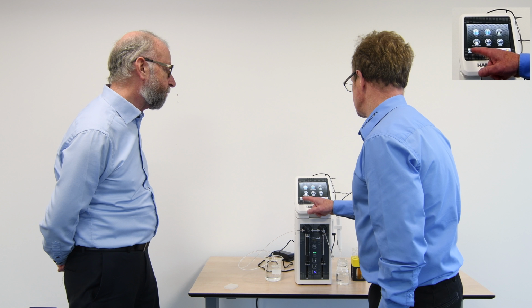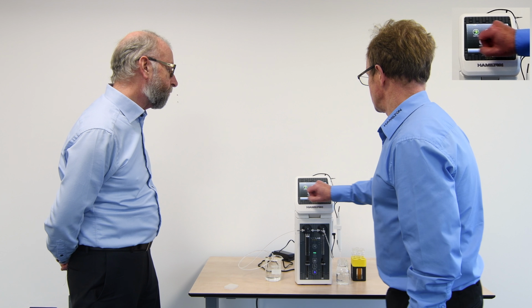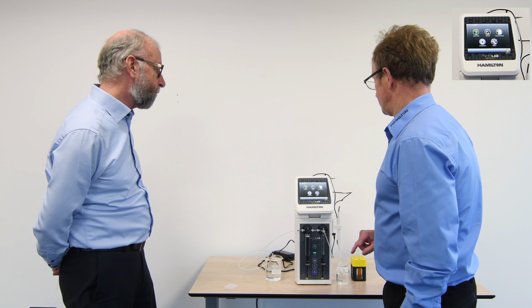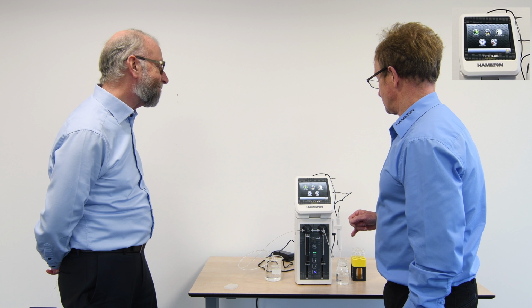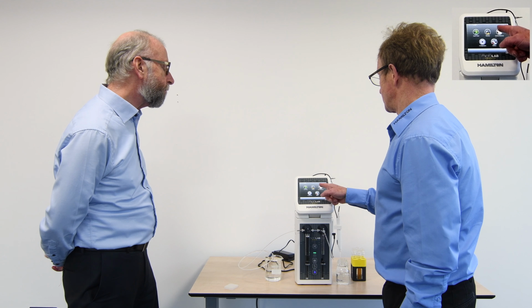So if I come back out of Wizards, and we come straight out of those programs, you'll see at the top function here we had Wizards showing. Yep. But we also had the custom programs. And this is the main menu. That's exactly it. And you'll see at the bottom right hand corner we have favourites showing. So if I had it stored as favourites, it would actually be here. If I was in my custom program, I saved it here.